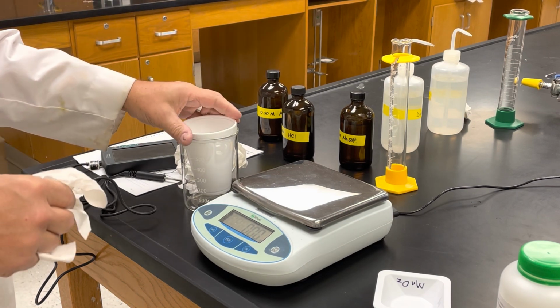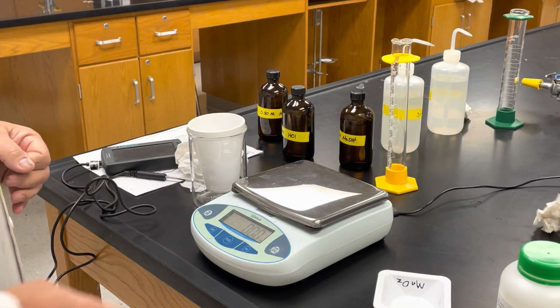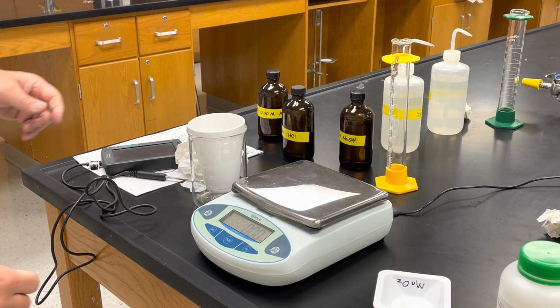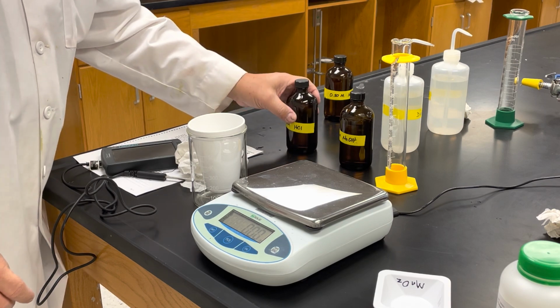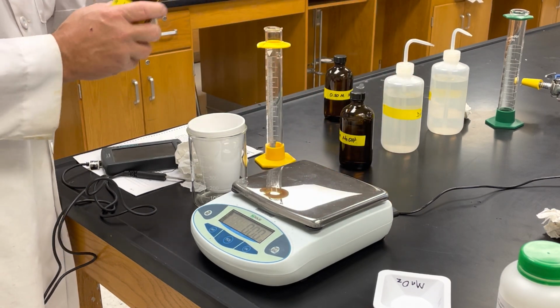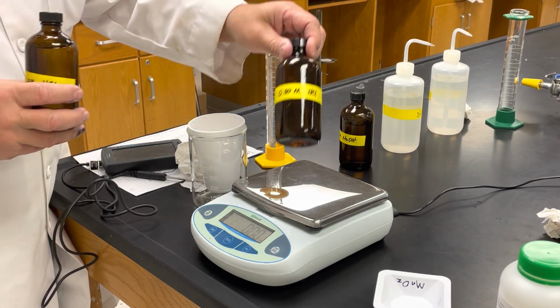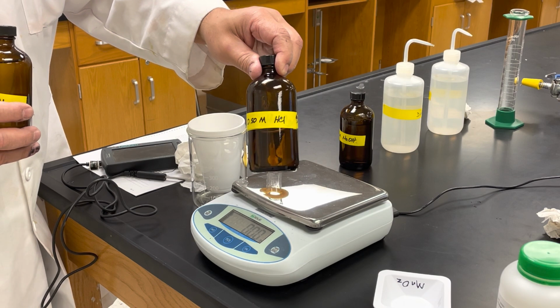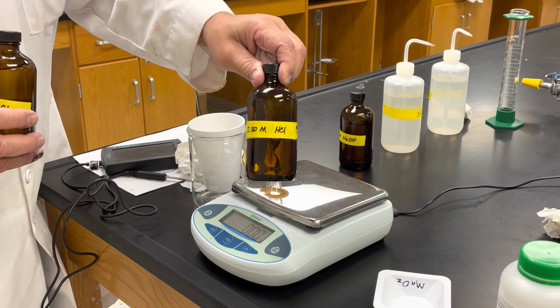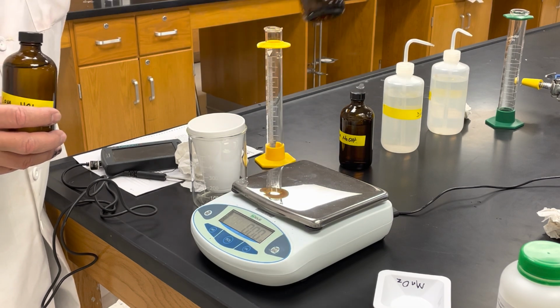Okay. So now for reaction 3, we're going to use 50 milliliters of acid and 50 milliliters of aqueous base. I'm going to use the same graduated cylinder for the acid, but this time it's 1 molar. Previously it's been the 0.5 molar HCl, and that needs to be in your data table as well. So on reaction 2, we used 0.5 molar HCl.